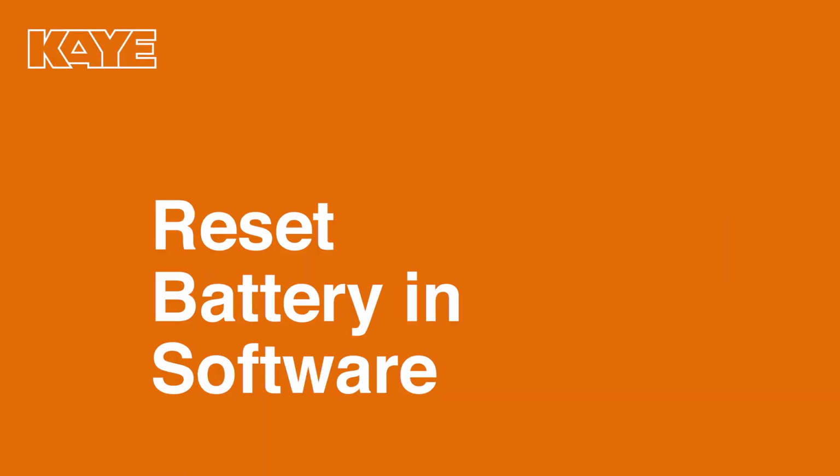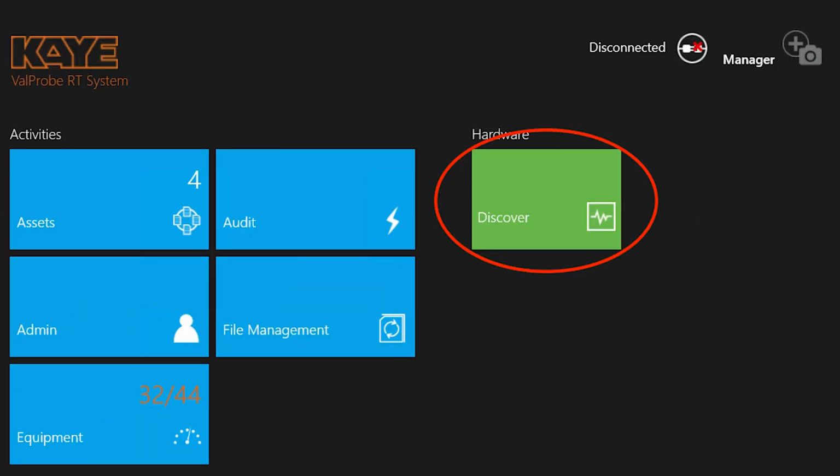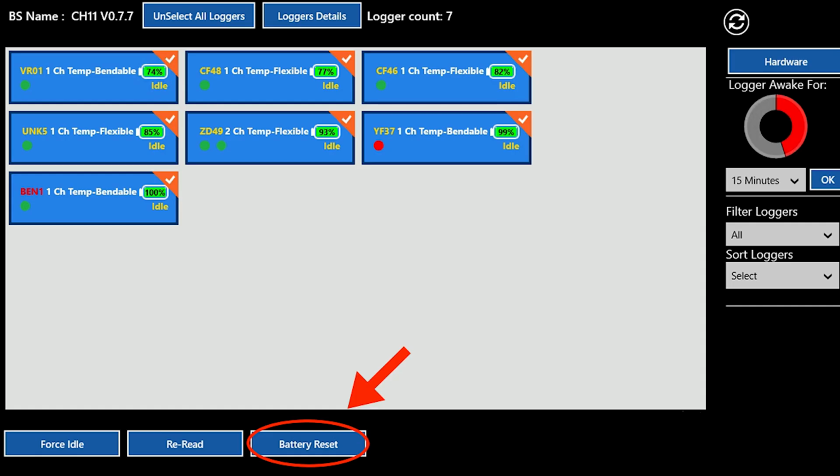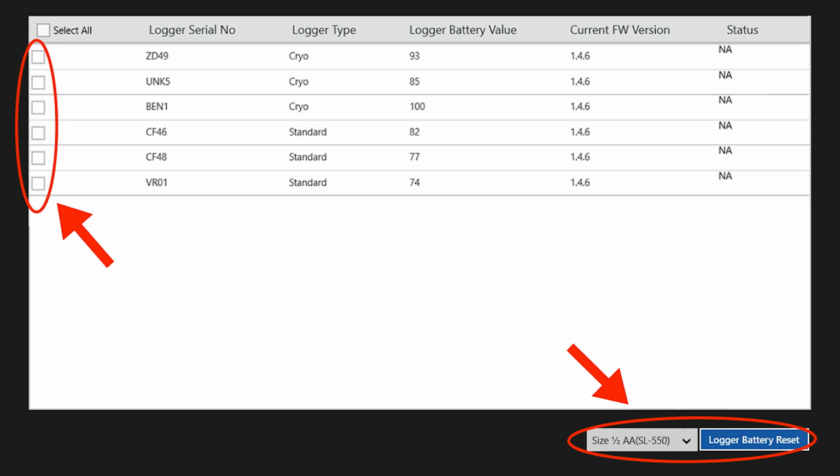After you've replaced the batteries, you must reset them inside the ValProbe RT software. Turn on your ValProbe RT software and wake up your loggers. Then click the green Discover box. Choose the base station that you're using and then press the green Connect button. Highlight the loggers that you'd like to reset and then press Battery Reset. On the left-hand side, check off the batteries that you'd like to reset. Then choose the size of the batteries that are inside your loggers.